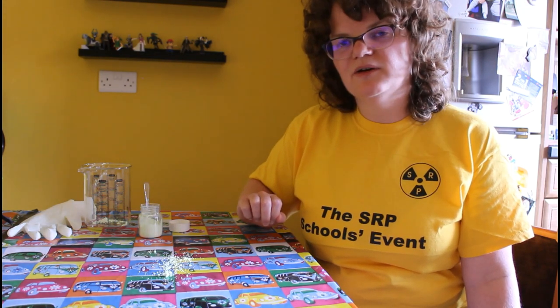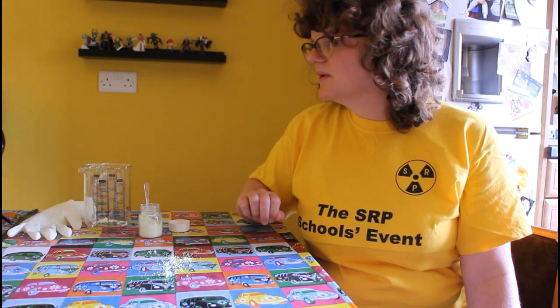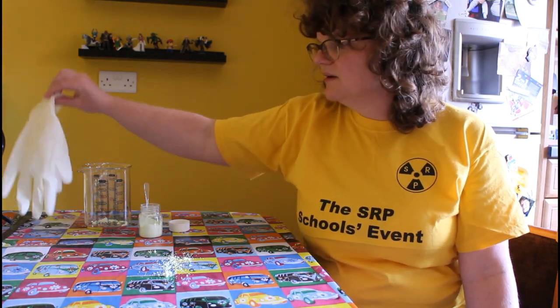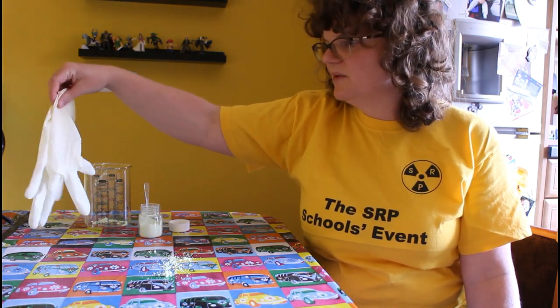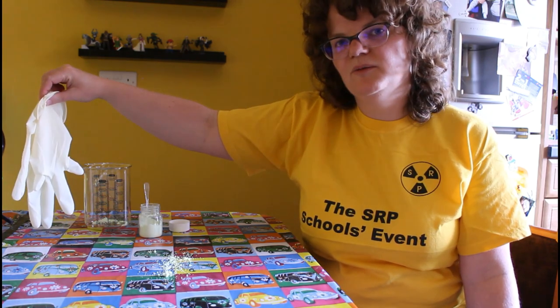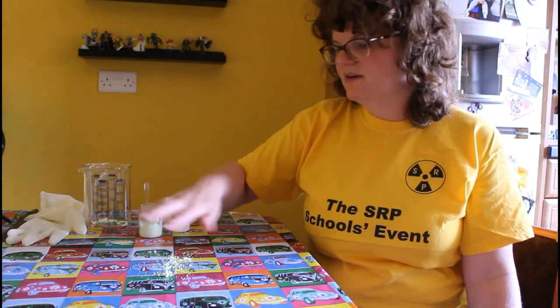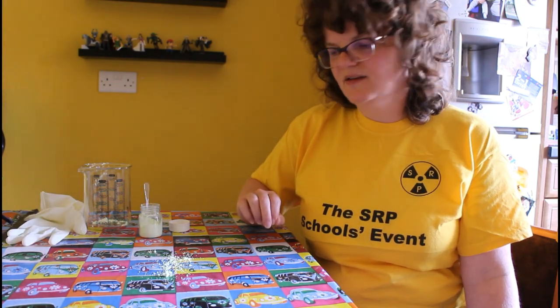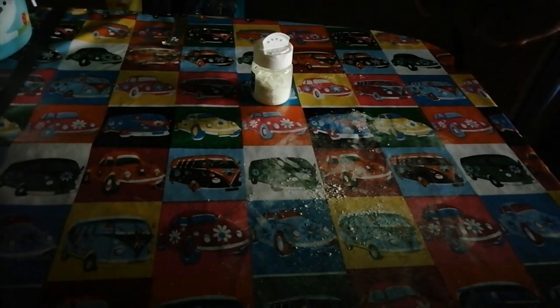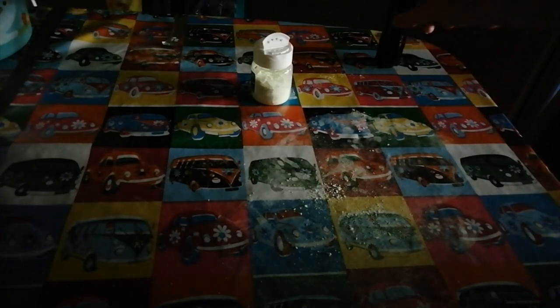So the next thing we're going to do is lower the light levels a little bit because we're going to look at some gloves and personal protective equipment. We're going to look at how effective wearing gloves can be at preventing the spread of this contamination. I've got a little black light torch here to help us see the contamination.